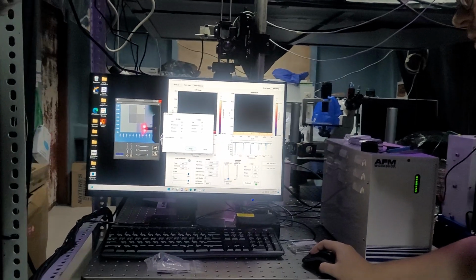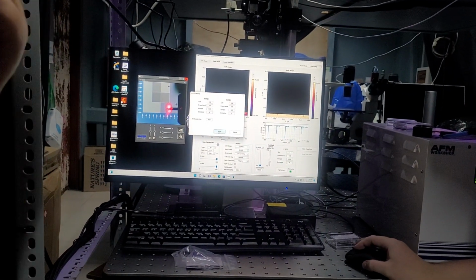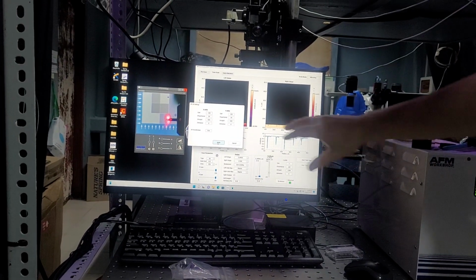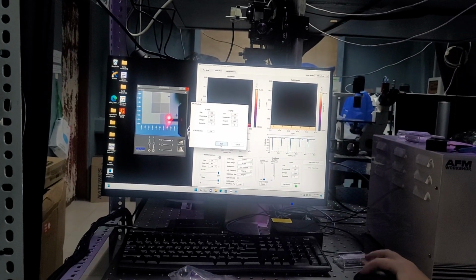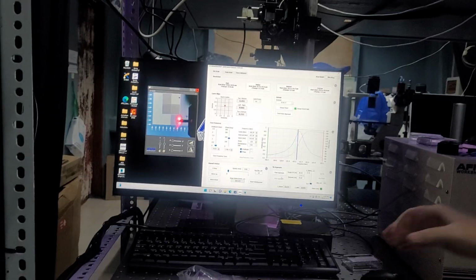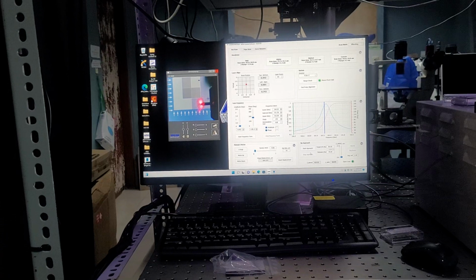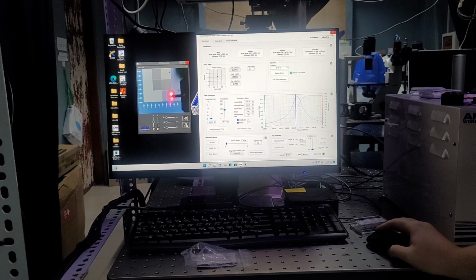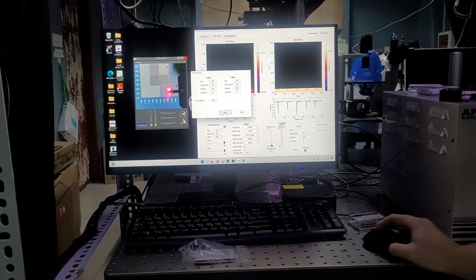Click Apply. So this is the X and Y GPID as well as the acceleration. Right now, for whatever reason, it's not applying whatever these values are, it's applying the default values. So you'll just need to click Apply. And you just have to do that once anytime the software is open. So before tip approaching, at some point, you'll just have to go over to the TopoScan, open the scan parameters, and click Apply.